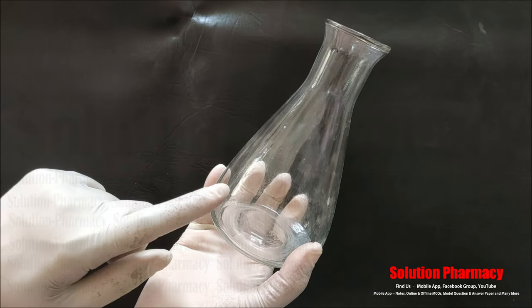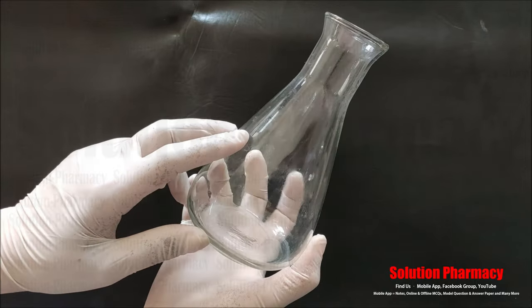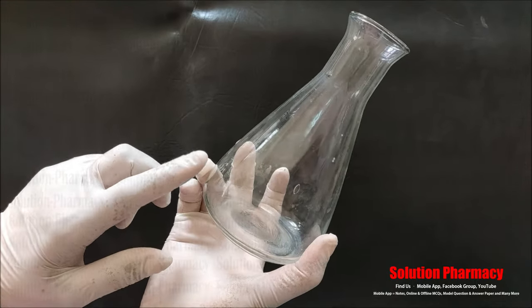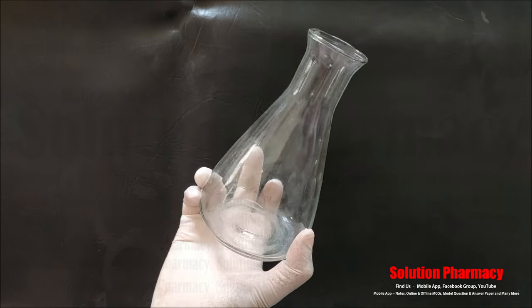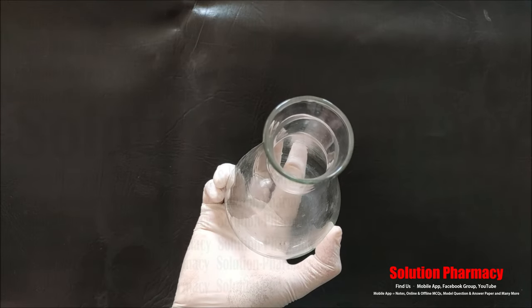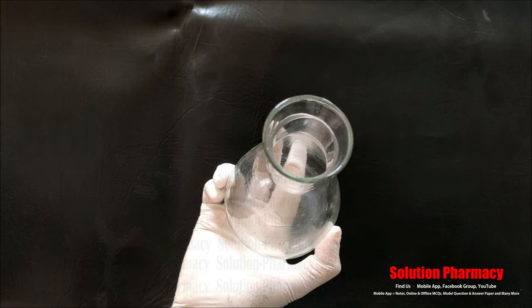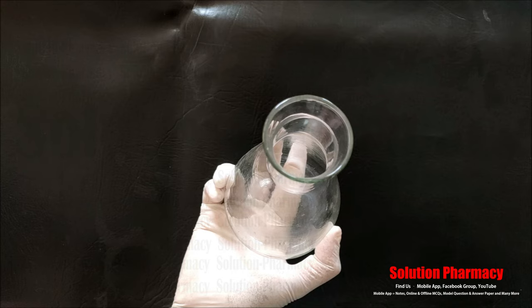You can also see this conical flask has no graduation for volume measurement and is made of soda lime glass — not borosilicate glass. This means we cannot use this conical flask for high temperature applications.